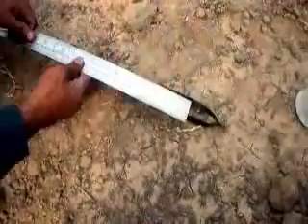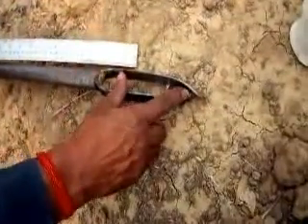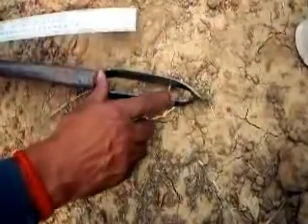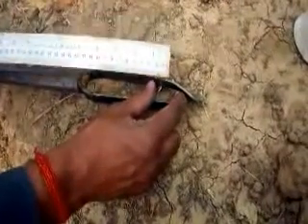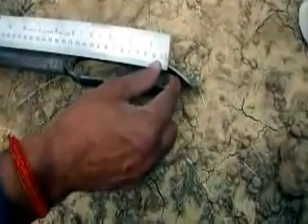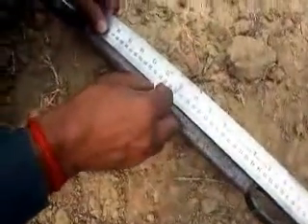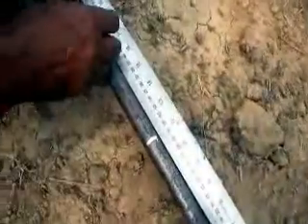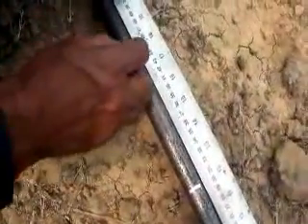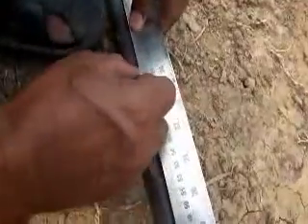So now let us take the gravimetric moisture sample, because this is an auger which is collecting soil from different depths, and this is the portion where we will get our sample. So let us measure from here 30 centimeter, 45 centimeter, this is a screw, so we have better observation, and from here 60 centimeter up to this.